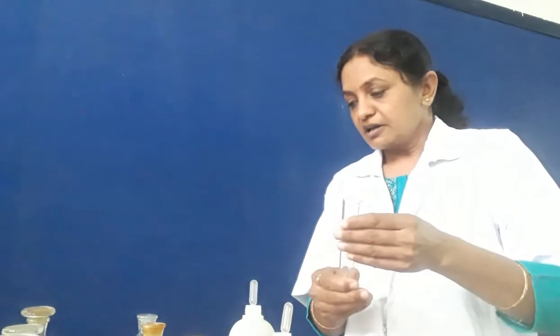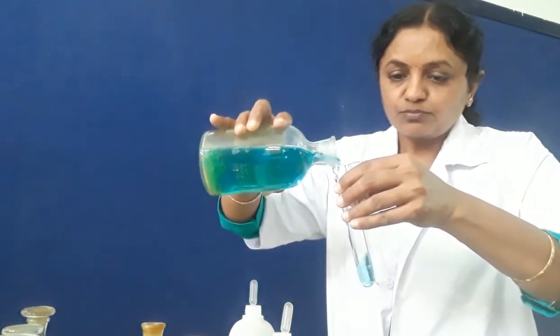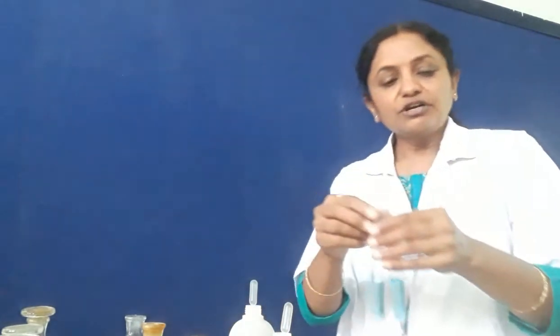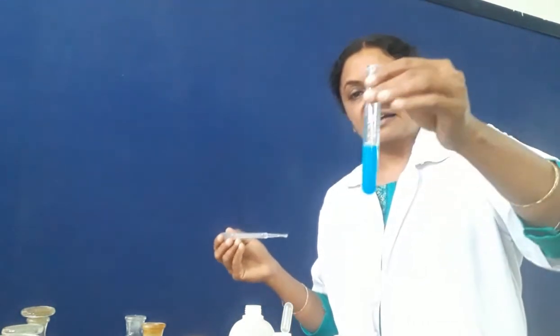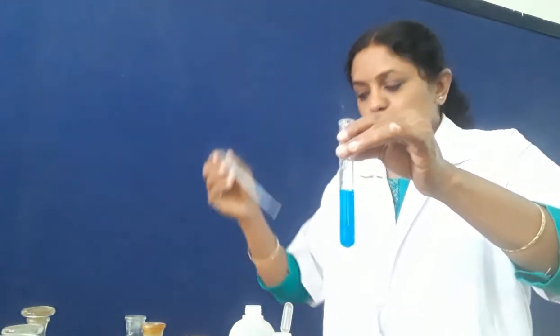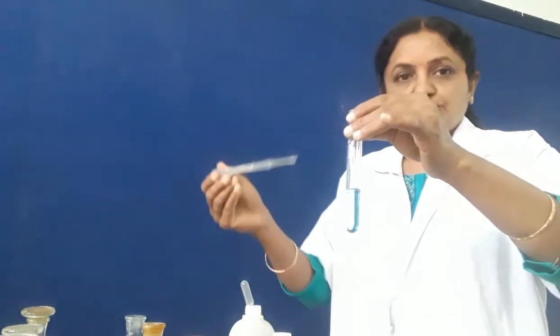Now we are taking copper sulfate solution, which is blue in color, in two test tubes. We add a very little amount of NaOH to the first test tube, and we see a pale blue precipitate. On adding excess of NaOH the pale blue precipitate remains as it is — it is insoluble.